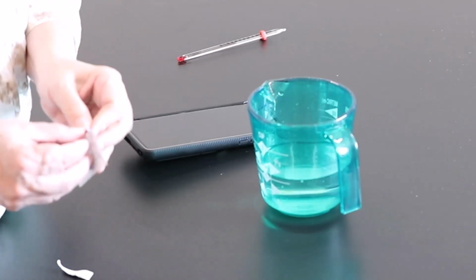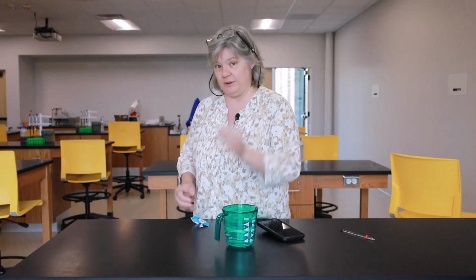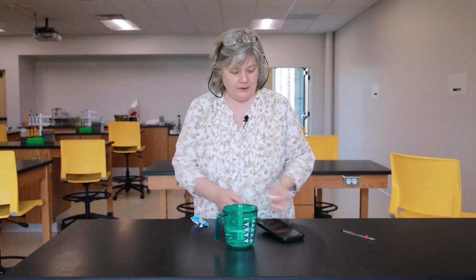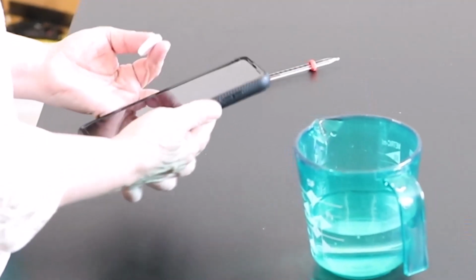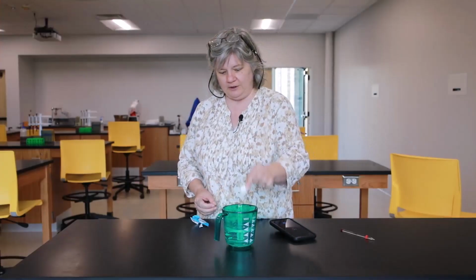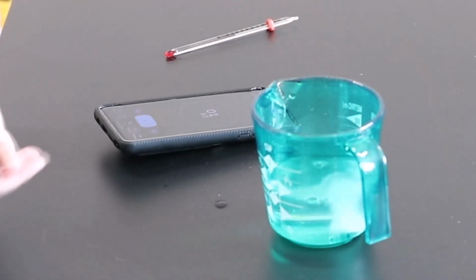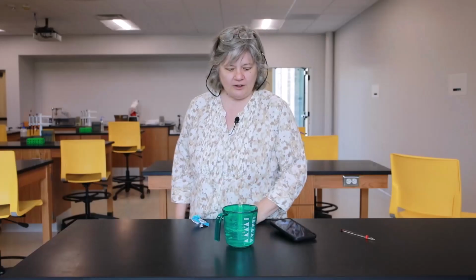tablet out. Now, for this particular experiment, it's important that your tablets are whole. So if you get a broken tablet, just put that aside, don't use it. Make sure you've got a whole tablet, okay? And then I'm going to get my stopwatch ready here, okay? And I'm going to put the Alka-Seltzer in the cup and press the start button at the same time. And I'm going to let that dissolve, and I'm going to watch it as it bubbles, and I'll stop my stopwatch when that Alka-Seltzer tablet completely finishes dissolving.